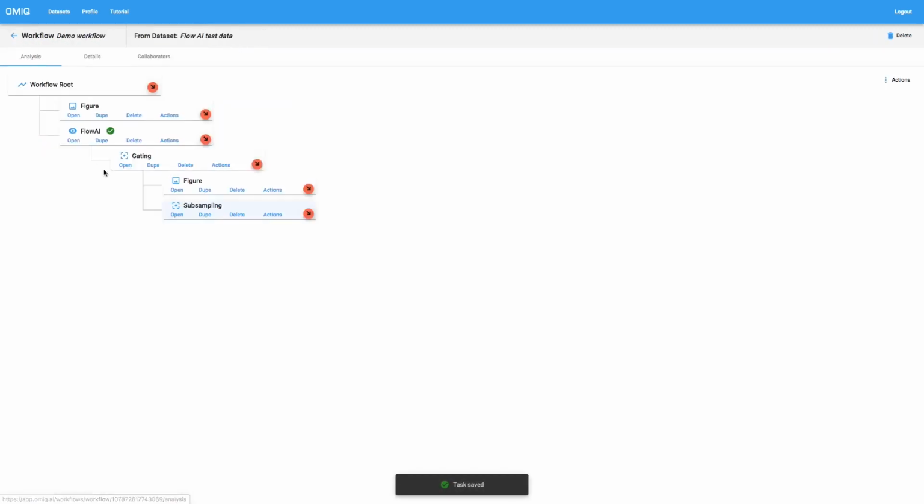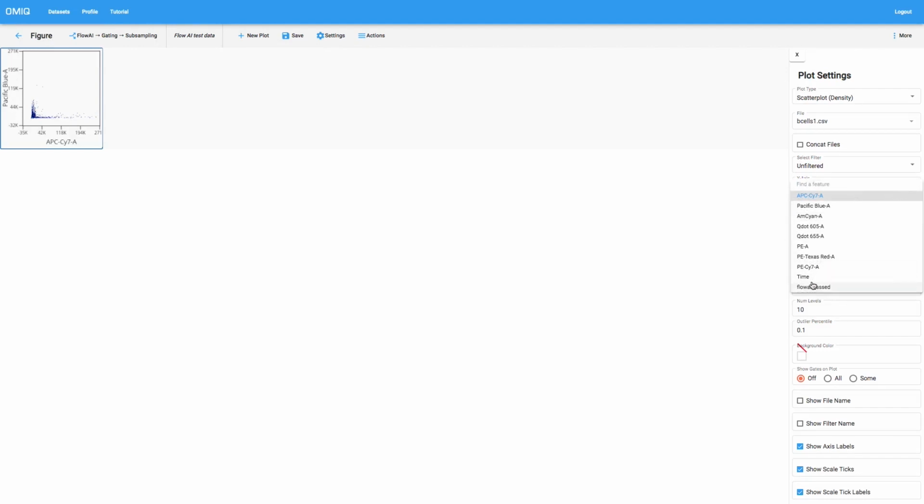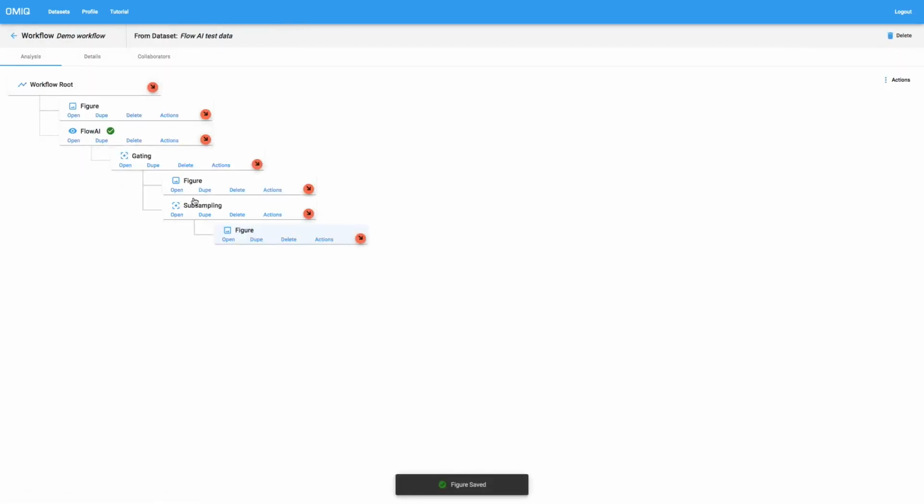So we'll save. And now anything south or downstream of the subsampling task, so for example, if we made a plot here, we'll actually see that this plot is going to have only the flowai-passed data points, and we'll recognize that this is the clean section. So again, that subsampling step, as you already know from your OMIQ experience, is key to actually take one of these filters that we have available and actually subsample it within the context of the workflow.